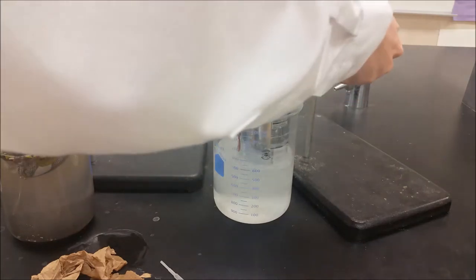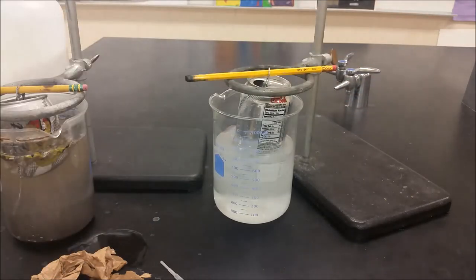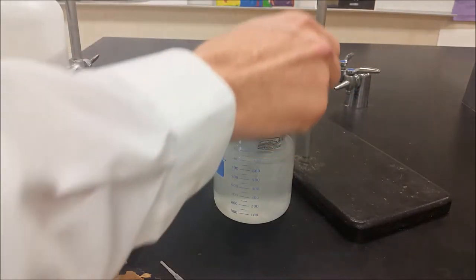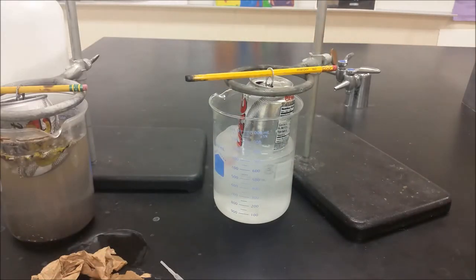Okay, so here we have a regular Diet Coke can and what I want to do is just add a little bit of hydroxide to the inside of it and a little bit of hydroxide to the outside of it.